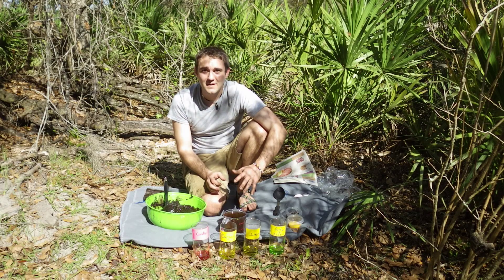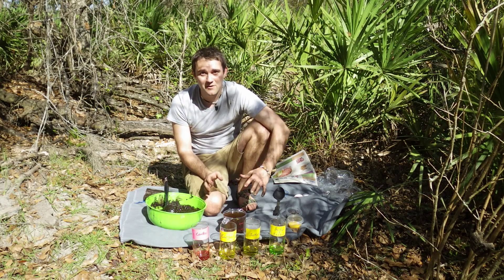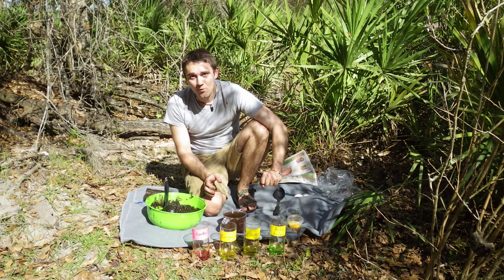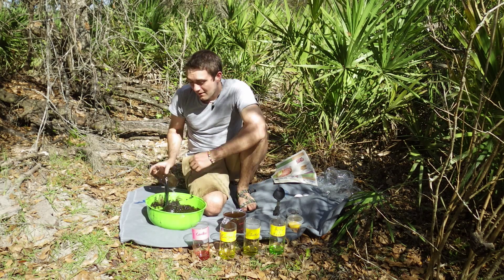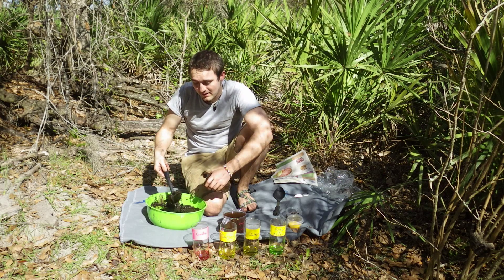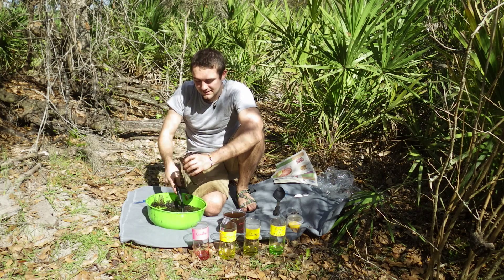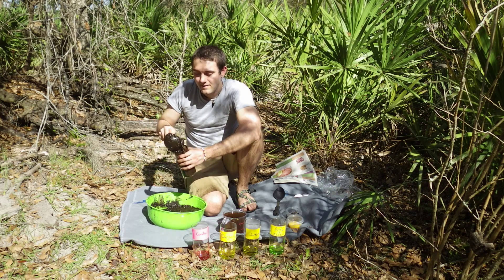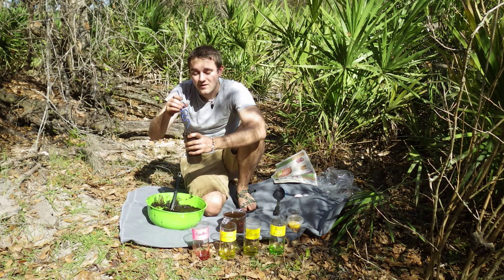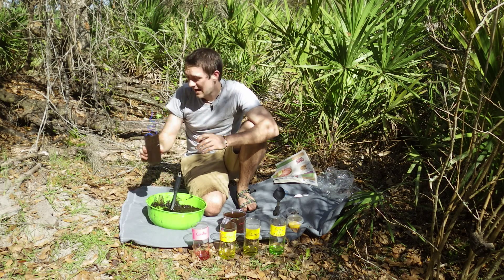We finally made it to the upland lab station where we're going to actually make the Winogradsky column. Here we have all the supplies we need. The most important ingredient, as I said, is the mud. As you can see, the mud is a milkshake-like consistency, and this is the consistency we want in order to make the columns and grow the bacteria. I'll put this aside for later.